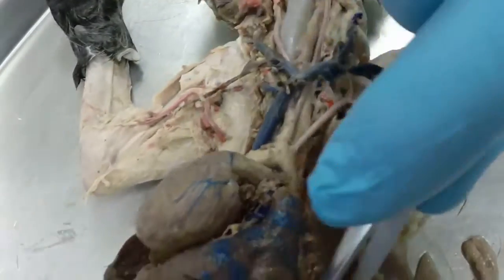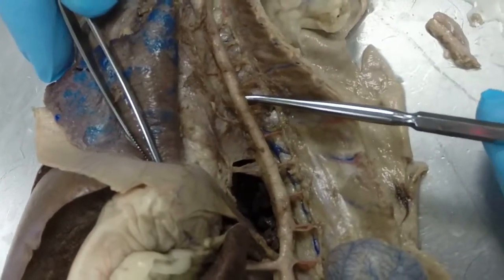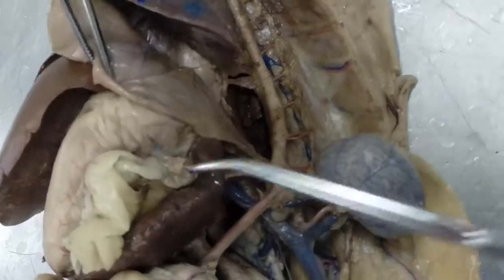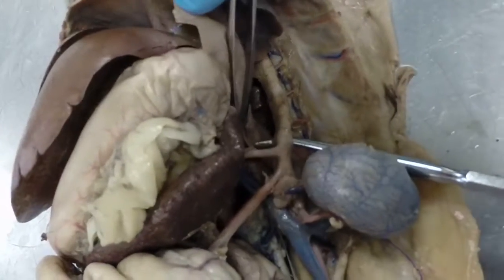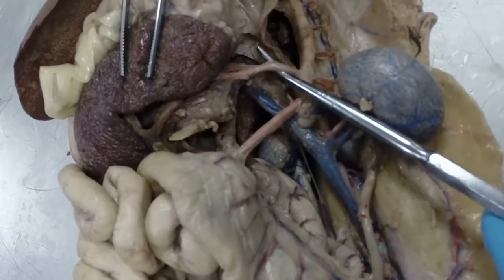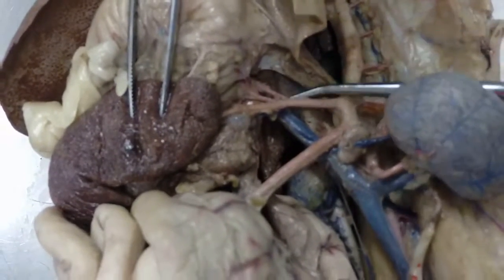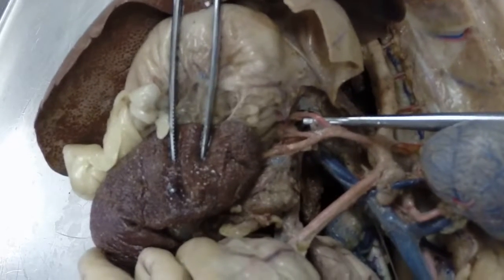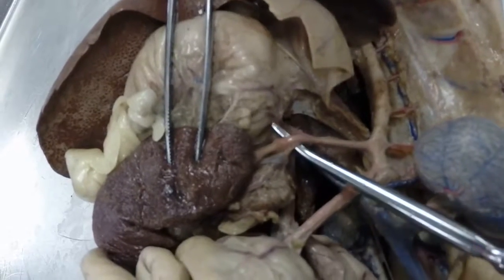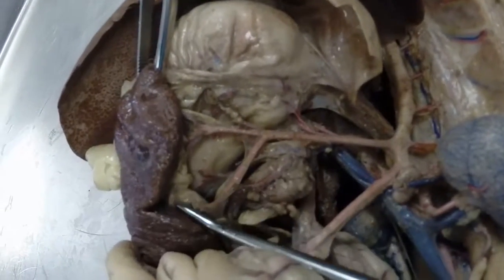If we now move into the thoracic cavity, this is going to be our descending thoracic aorta, and then where it crosses through the diaphragm, which is this muscular flap right here, we're going to call it the descending abdominal aorta right there. So the first branch off the descending abdominal aorta is the celiac artery right here, and this has 3 branches coming off it. The first of which is called the hepatic artery right there. The second branch is the gastric artery, and the third branch is the splenic artery, and the splenic artery is going to branch a few more times going to the spleen, which is right here.